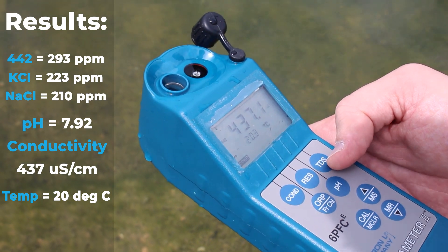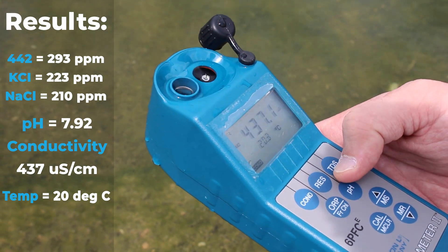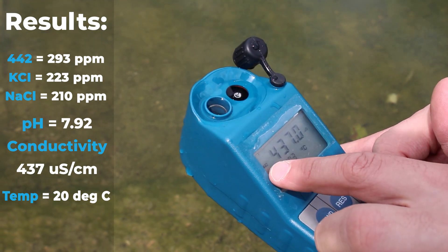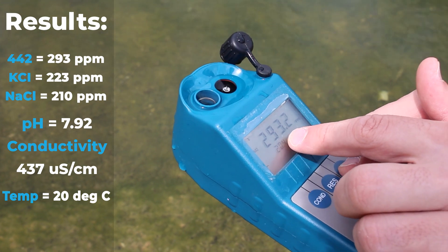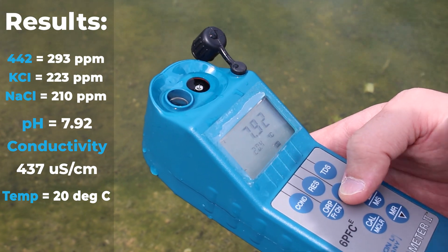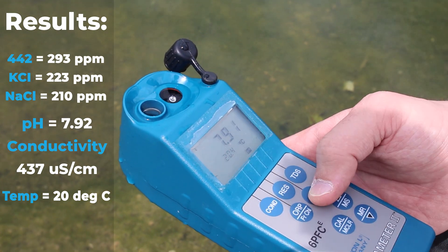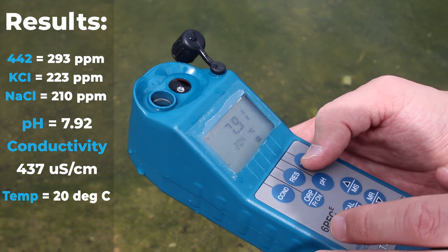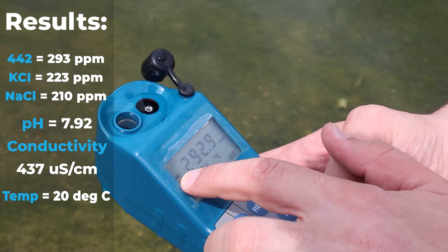So we can see that conductivity is the highest value at 437 µS/cm, TDS as 442 is 293 ppm which is the second value, and pH is almost neutral — slightly alkaline — at 7.91. Now we can measure the TDS using the other measurement options, not 442.